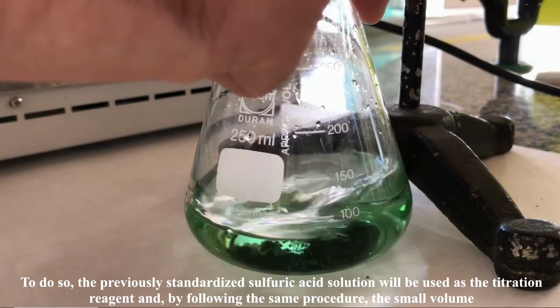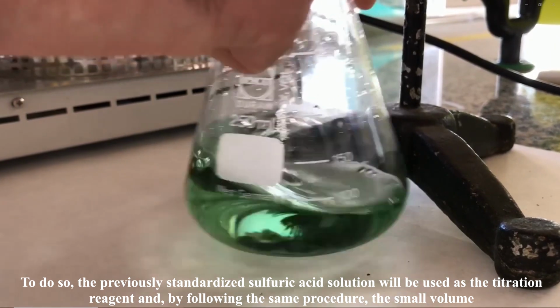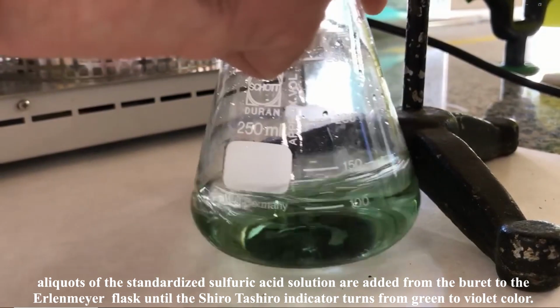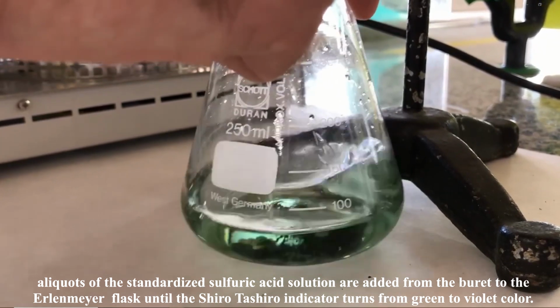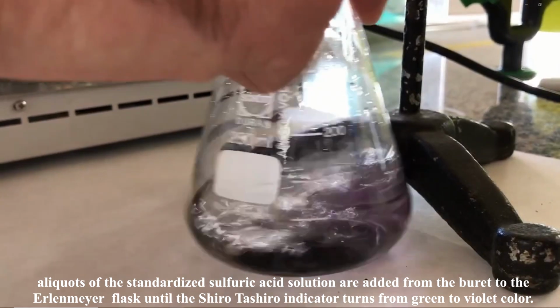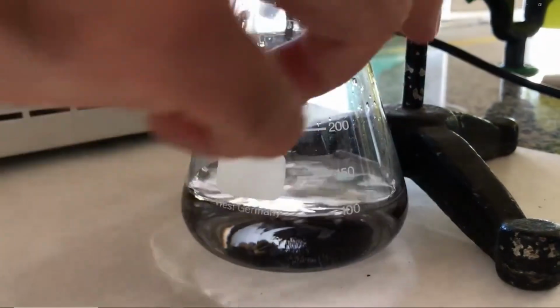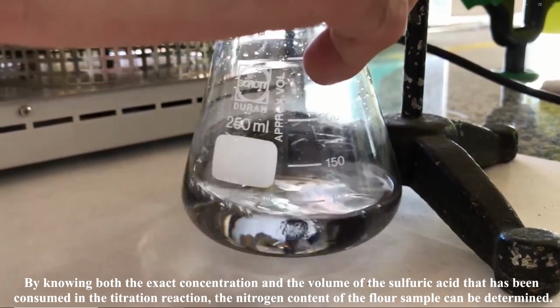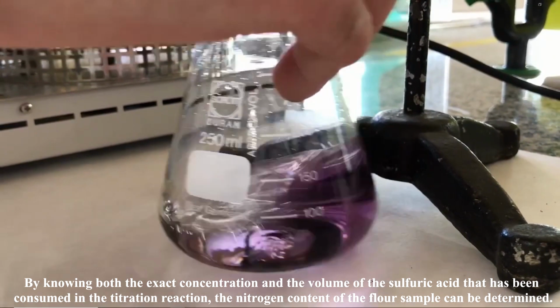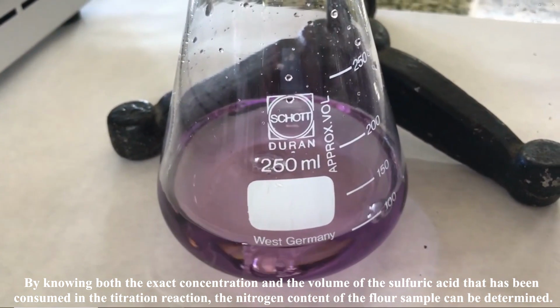To do so, the previously standardized sulfuric acid solution will be used as the titrant reagent and, by following the same procedure, small volume aliquots of the standardized sulfuric acid solution are added from the burette to the Erlenmeyer flask until the Tashiro indicator turns from green to violet color. By knowing both the exact concentration and the volume of the sulfuric acid that has been consumed in the titration reaction, the protein nitrogen content of the flour sample can be determined.